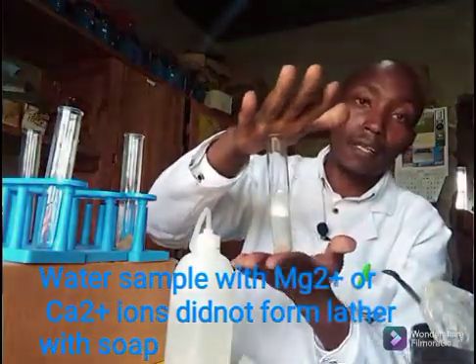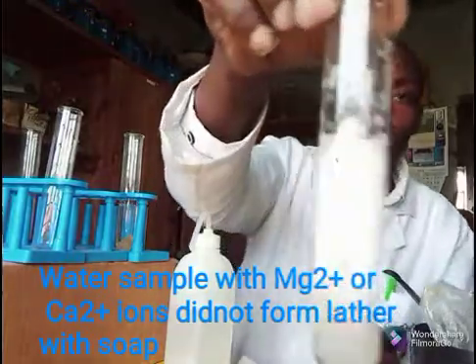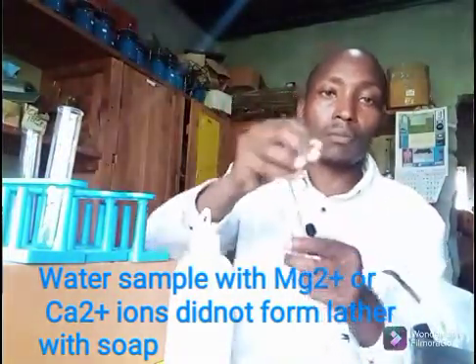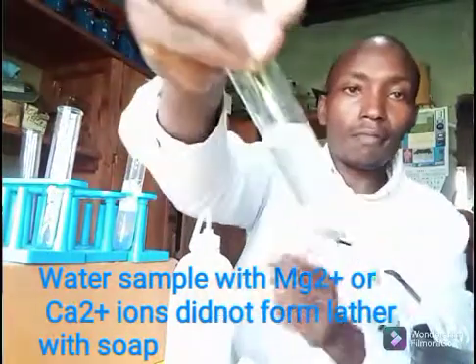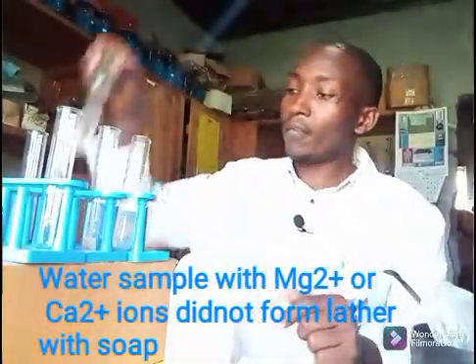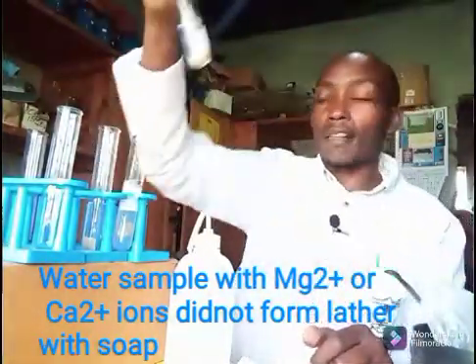The one without calcium or magnesium — just observe what has happened. The lather has formed very easily with soap. But look at that — this one is not forming lather easily with soap. Even the one with calcium: however much I shake it, it is not forming lather.